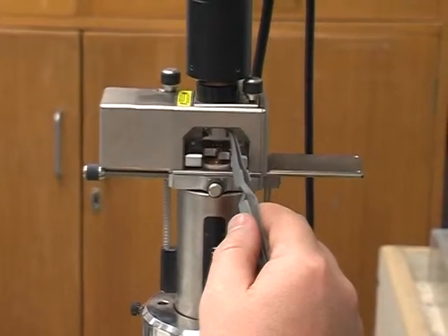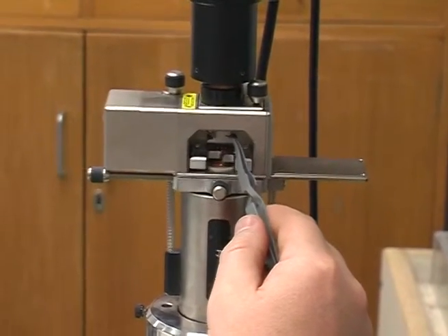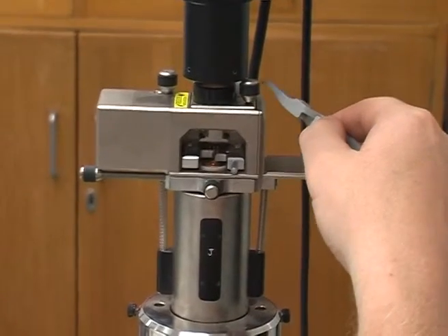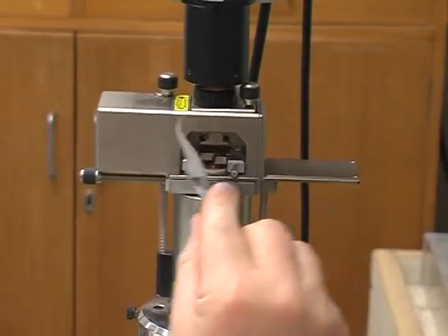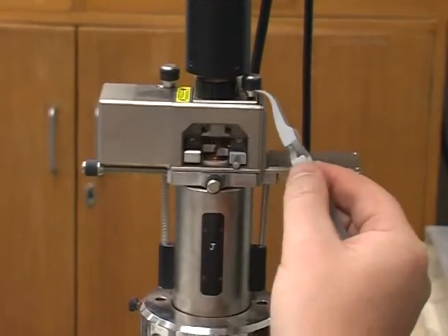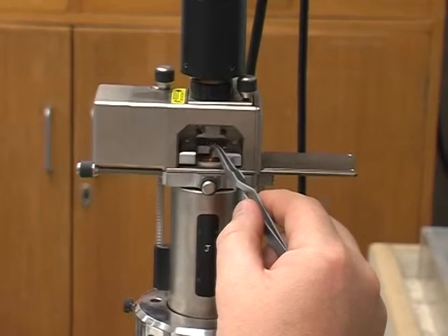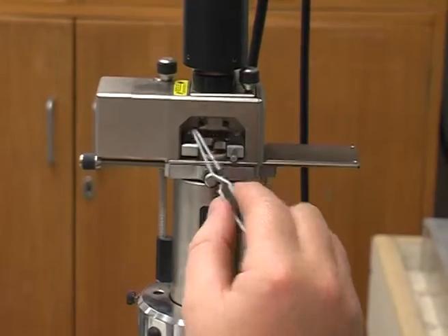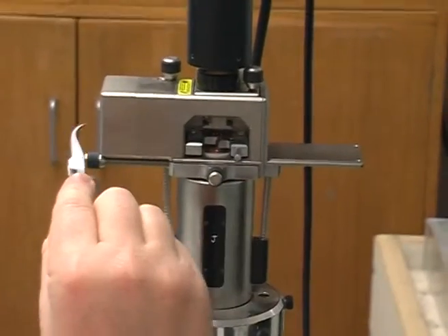Tip holder, that's a mirror there. The laser comes in from actually back here. There's another mirror there that is immovable — it reflects the laser back down onto the back of the cantilever. It bounces up off the mirror and then goes into the photo diode here.